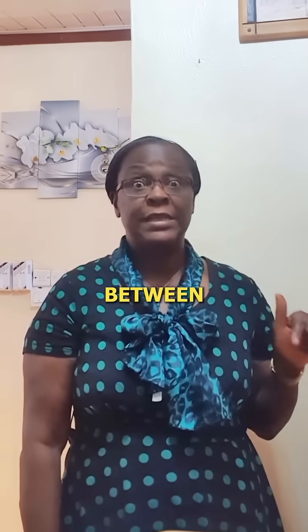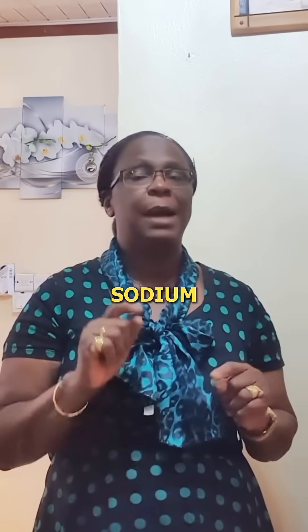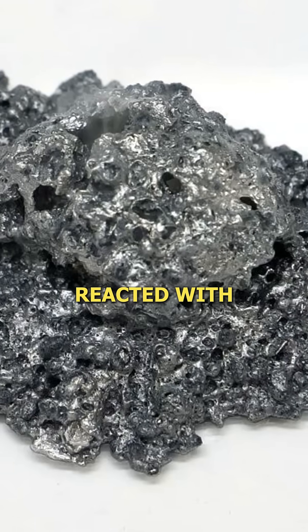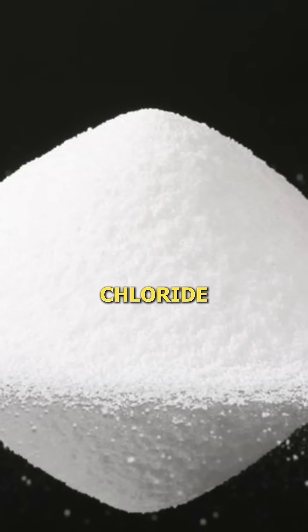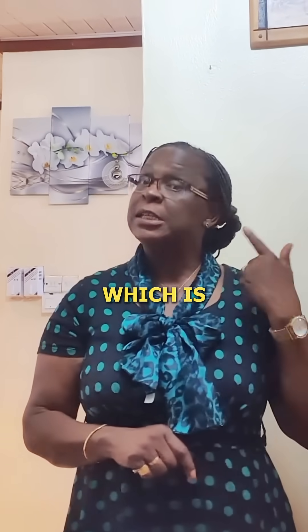This is a reaction between sodium and mercury. Mercury is the only liquid metal, and this reaction produces sodium amalgam, which is NaHg. When sodium amalgam is reacted with cold concentrated ammonium chloride, you produce ammonium amalgam, which is unstable.